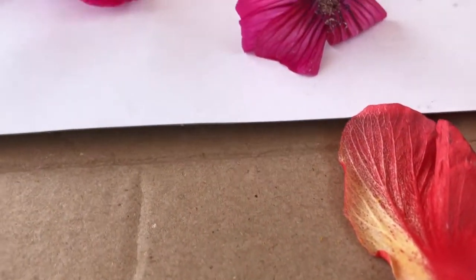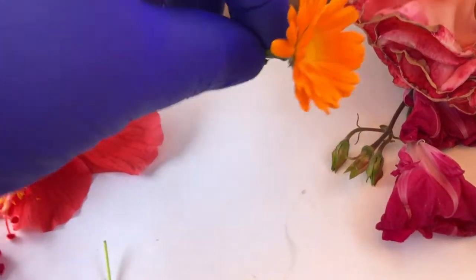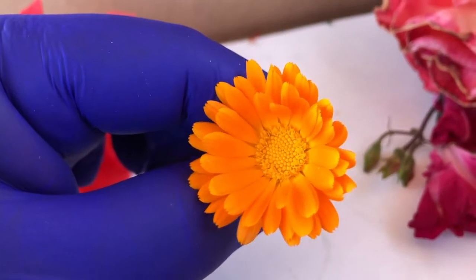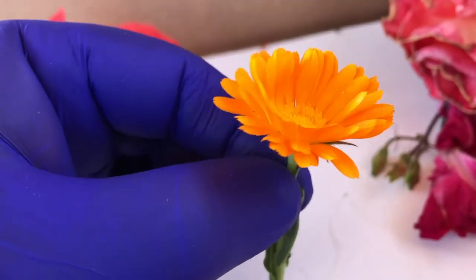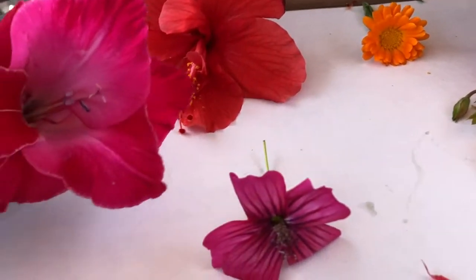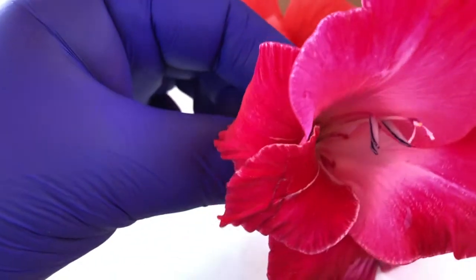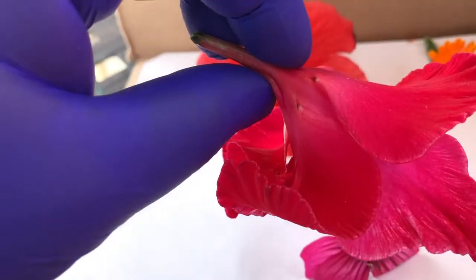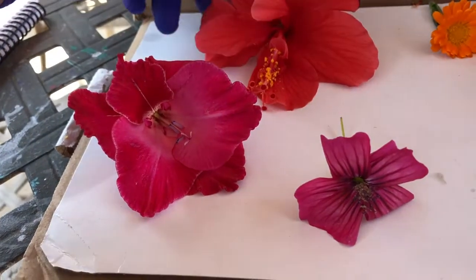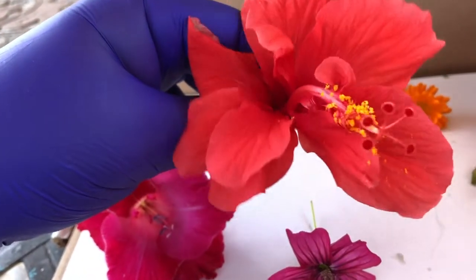And so we're going to look at a few different flowers and learn about how flowers such as these are designed for insects that are a little bit more clumsy, if you will, kind of like beetles. These serve a little bit more like a launch pad, while others are a little bit more intricate and require either insects or birds to get inside. Some, if they're long, are good for animals with long beaks like hummingbirds and such. Others are really good for things like bees to be able to get in there.